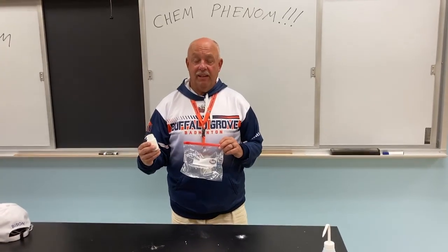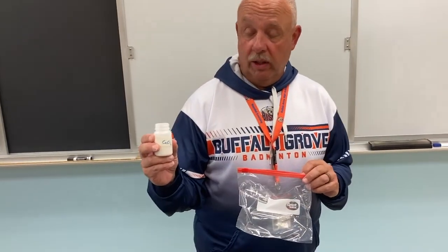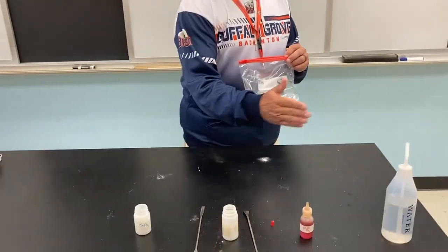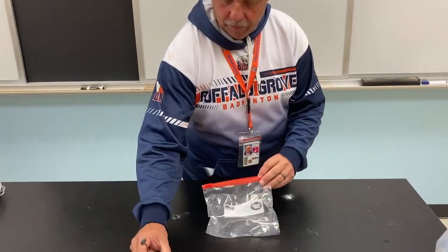All right, back again. So we're going to go with our third little get together, and we're going to go with the calcium chloride, and we've already tried it with another solid, so we're going to actually try this with the water and see what happens. So just the water. Okay.